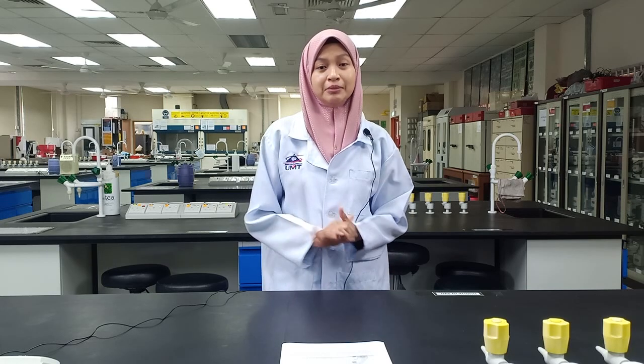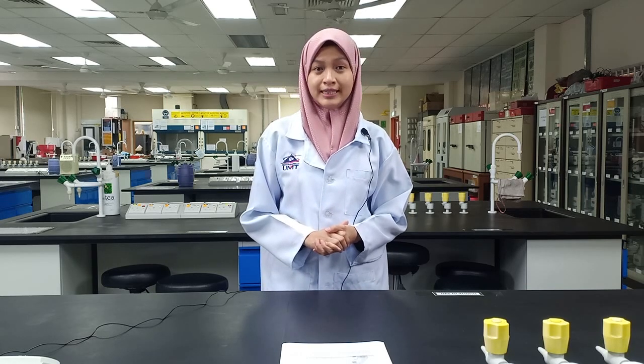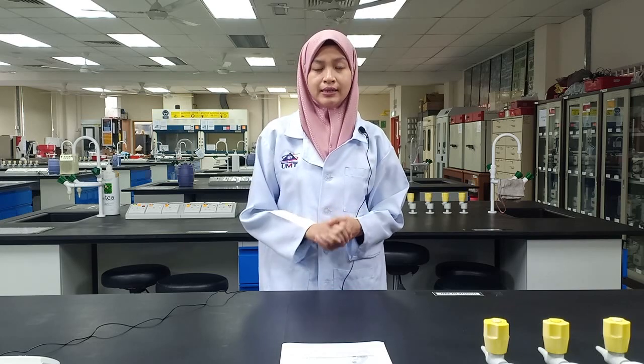Slide preparation, calibration, and also size measurement. They have different methods to sample phytoplankton, for instance, plankton net, water sampler, and flow cytometry analysis. Plankton net is the common method used with different mesh sizes depending on the study objective. In this practical, we will use a plankton net to sample phytoplankton with a mesh size of 60 micrometer.